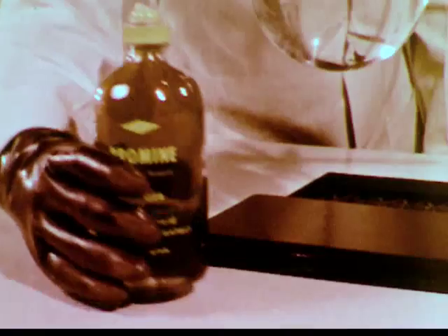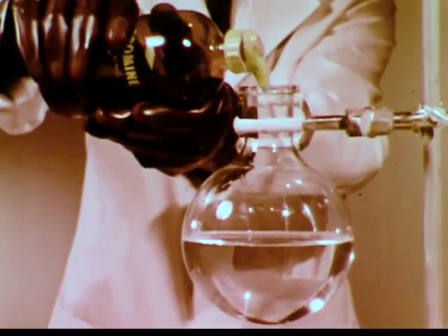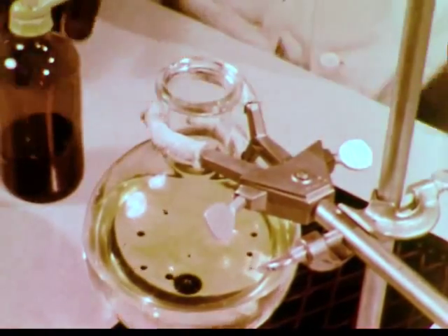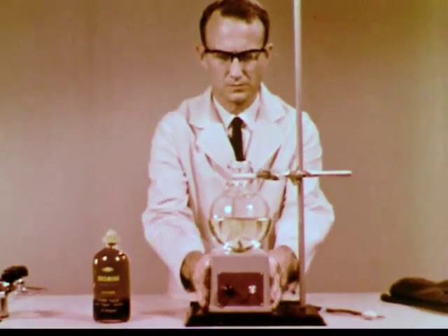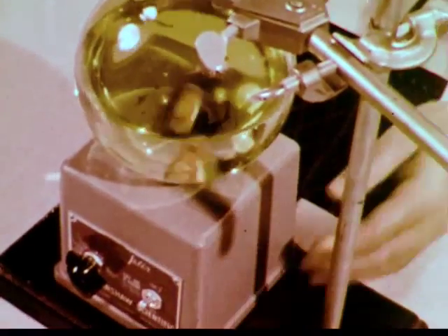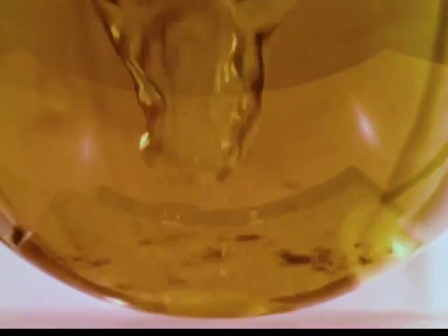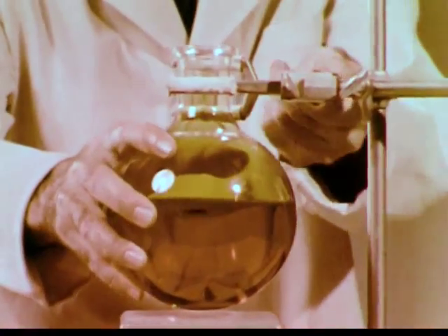But what about the solubility of bromine itself? When bromine is added to water, it settles to the bottom, indicating it is more dense than the water. Now we'll mix the bromine and water with the help of a magnetic stirrer and a plastic-coated magnetic stirring bar. Vigorous and prolonged stirring gives us a saturated solution. The brown color is characteristic of aqueous bromine solutions. However, some drops of bromine remain undissolved. This indicates that elemental bromine is not highly soluble in water.